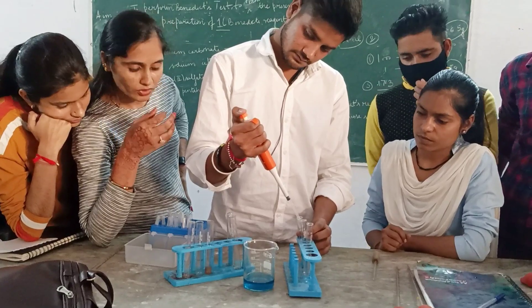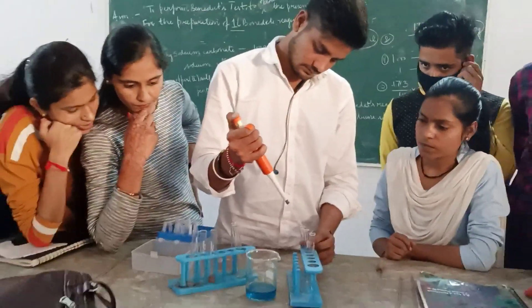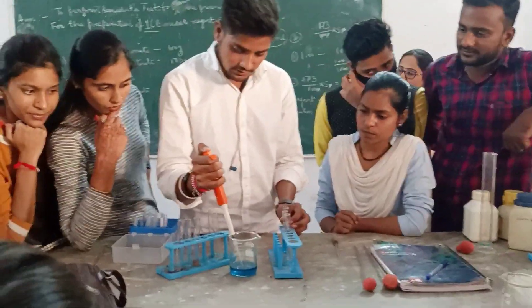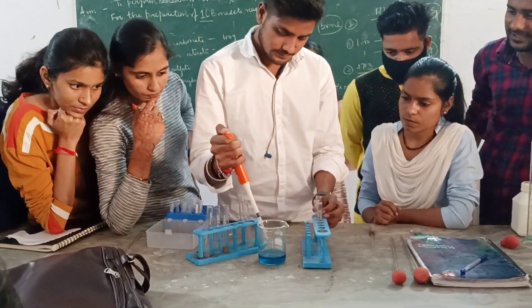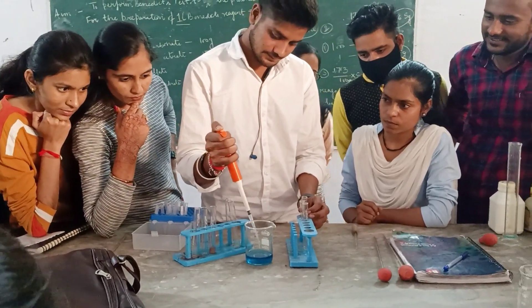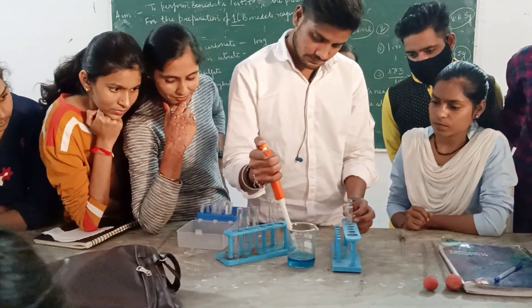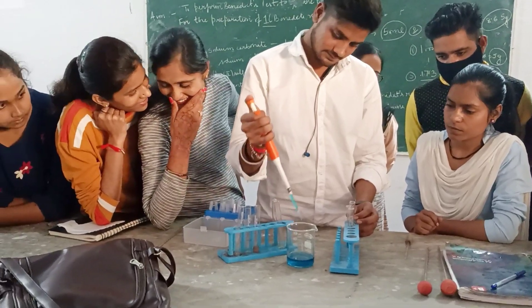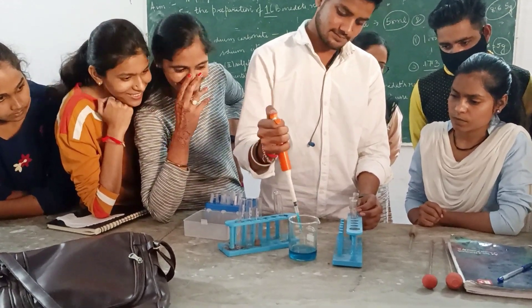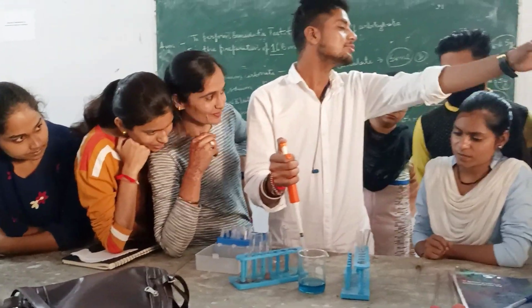Now we add this Benedict's solution into the test tubes, which already contain 1 ml of distilled water each. Now see the result — what happens in the test tubes. The test tubes will be placed in a water bath and we will observe the result.